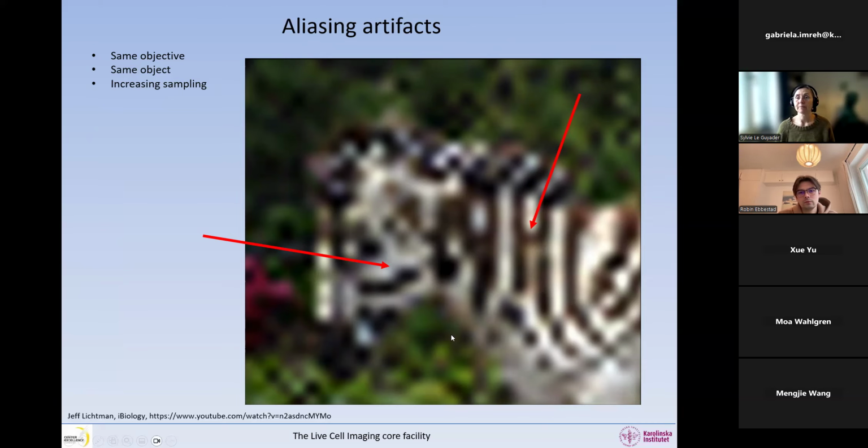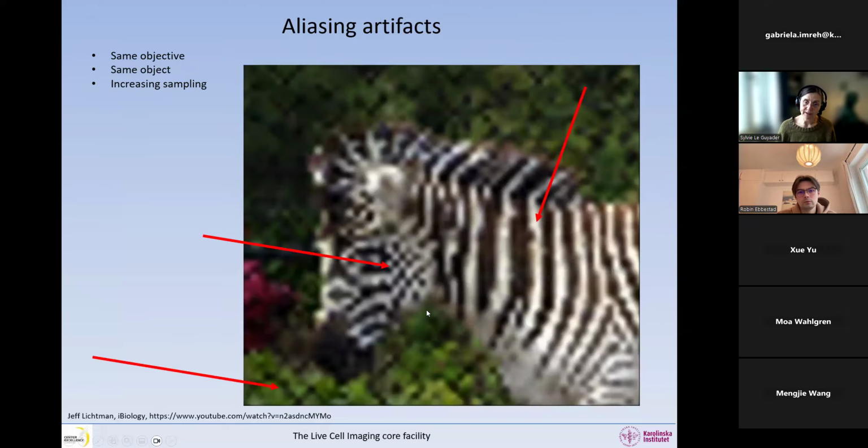Okay. So if we sample a little bit better, what we can see now is that, oh, this bridge disappears. But what we can see in here now, we have this sort of checkered pattern.